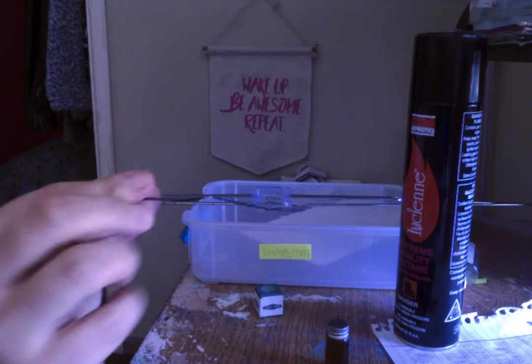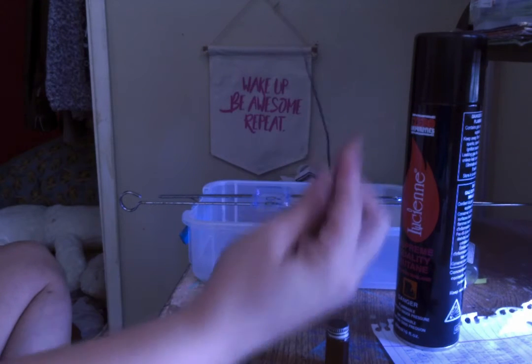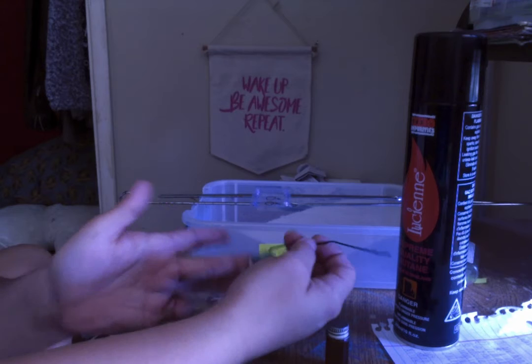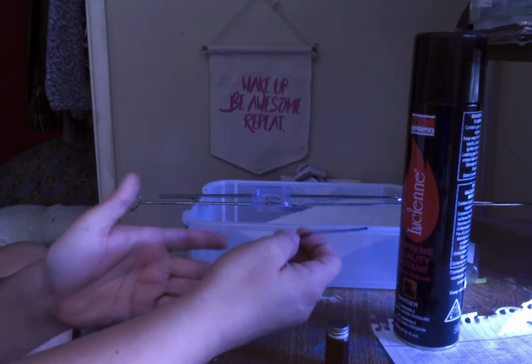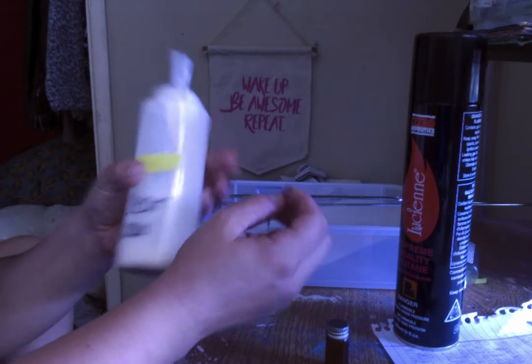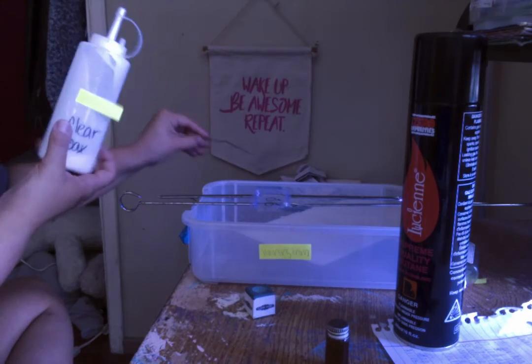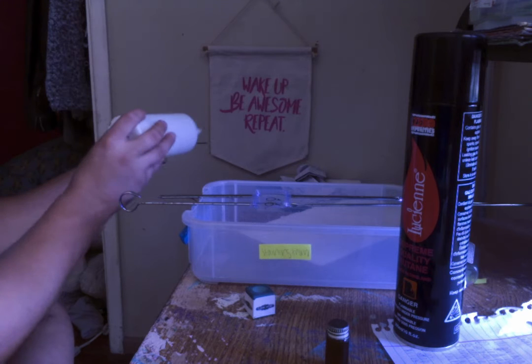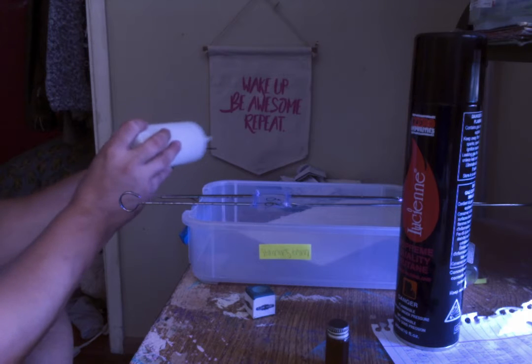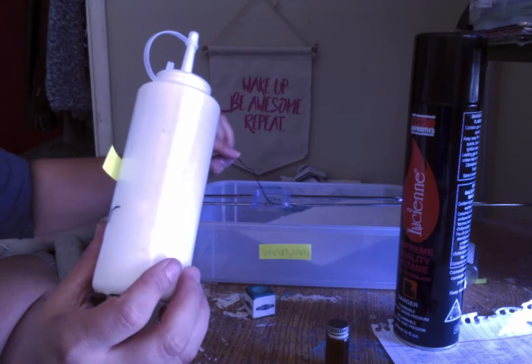Then you're going to run your inoculating loop back through the Bunsen burner, sterilize it, and in order to use a solid bacteria for the second circle on this slide, you have to have water. You have to mix it with water. And so you're going to put your inoculating loop over the sink. This is the imaginary sink over here. And you just put just a couple of drops to where you get like a thin film of water. And you're going to place that in the other circle.